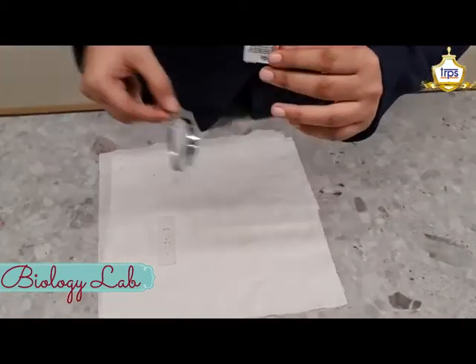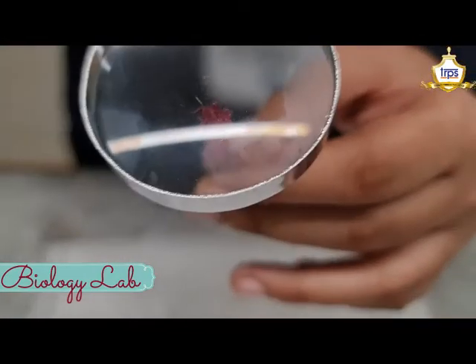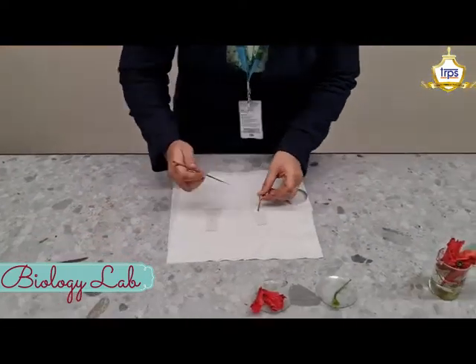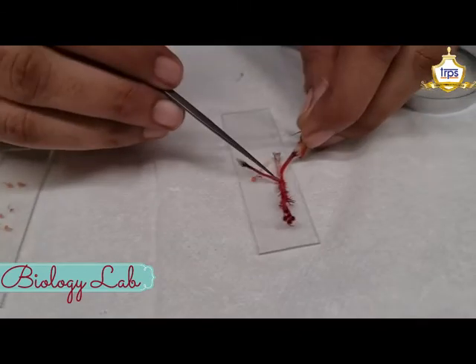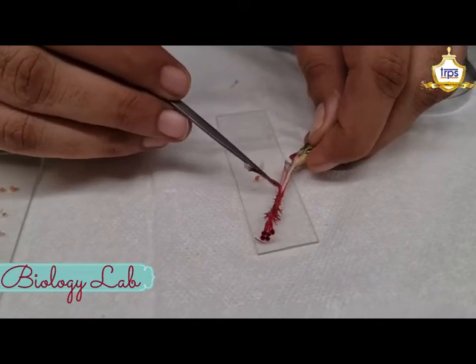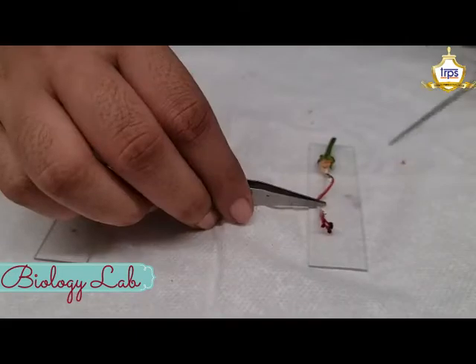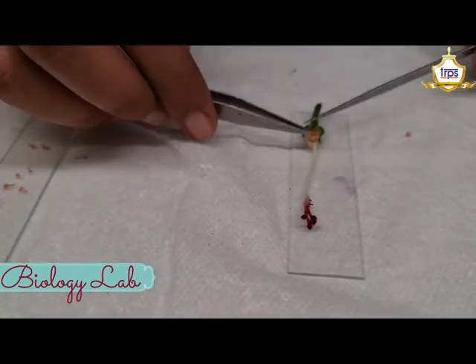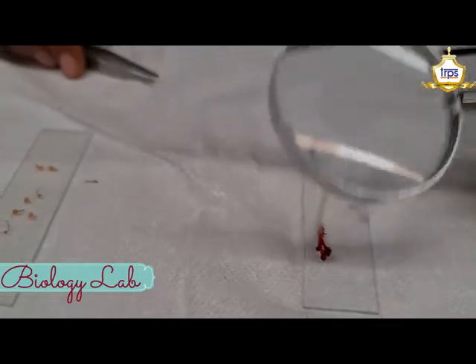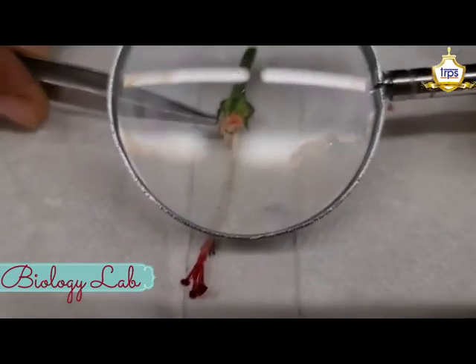Now students, let us take a look at this. As we can see, the top portion of this flower is called the stigma. Let us take a look at the style. Now as you can see, I have separated the tissue. Over here we can see this is the style. This is the style, this is the stigma, and here is the ovary.